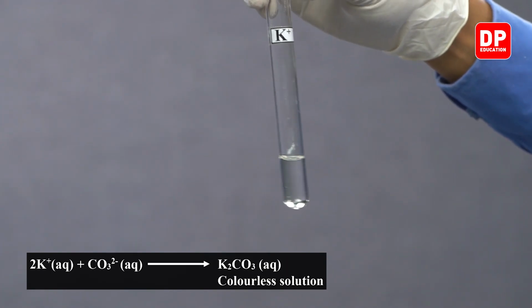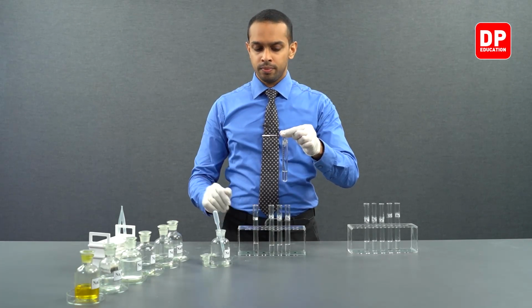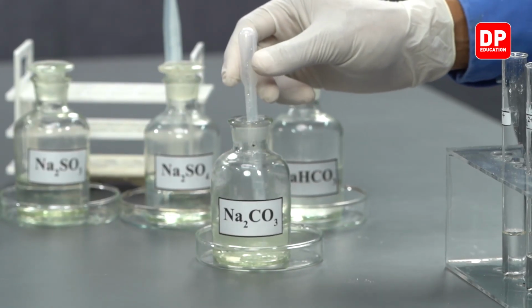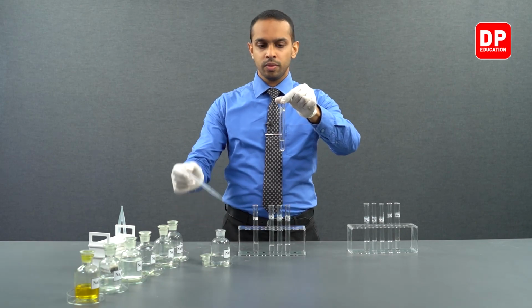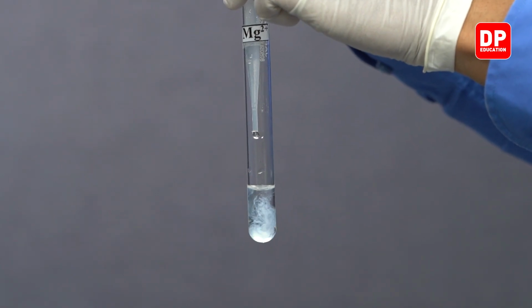Potassium 1 plus ions, when reacted with carbonate ions, will not form a precipitate. All the group 1 cations, when reacted with carbonates, will not form a precipitate as they are water soluble, except for lithium carbonate. Let's move on to magnesium. We have magnesium 2 plus aqueous solution here. Let's add a small amount of sodium carbonate into this.